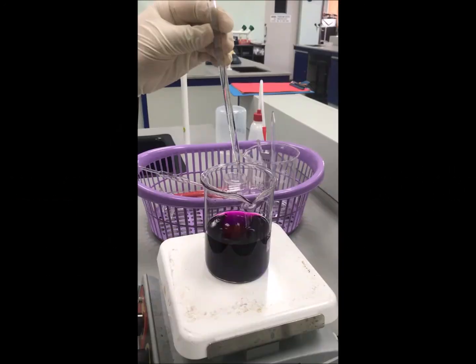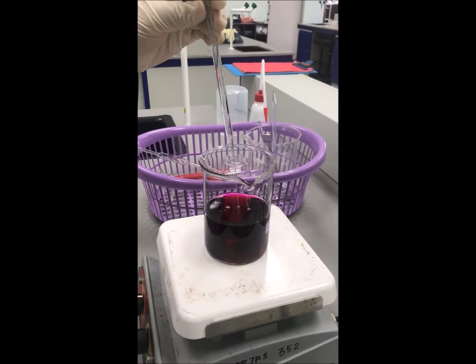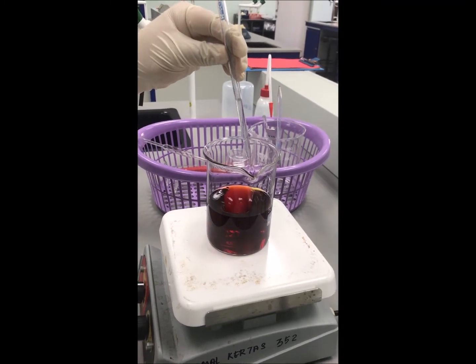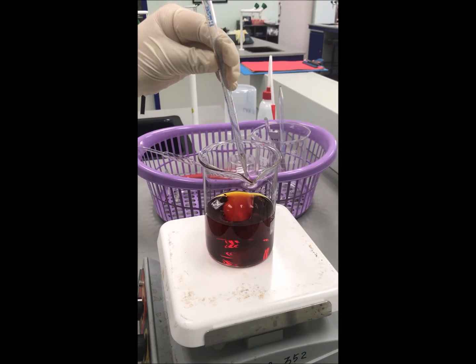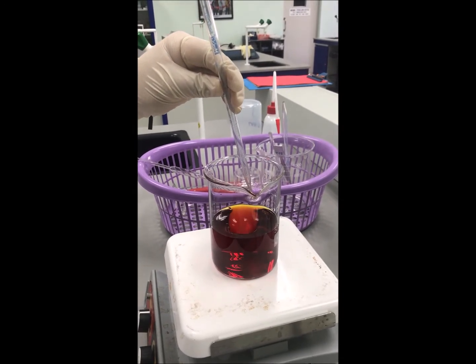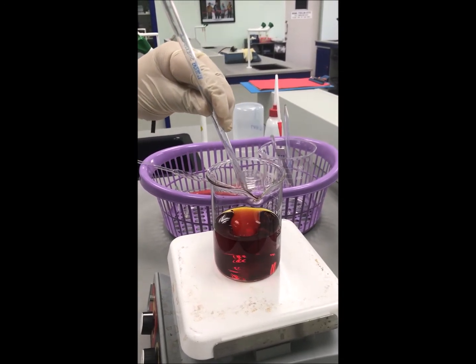Upon completion, add in the potassium iodide into the reaction beaker. The color of the mixture will change from purple to dark brown, which is due to the releasing or generating of iodine.